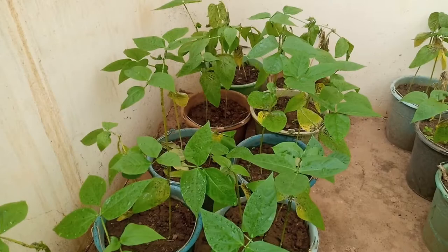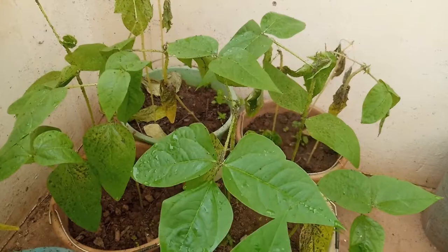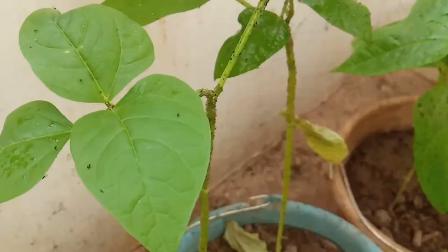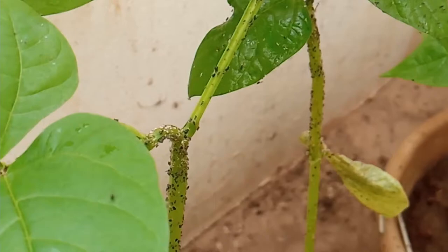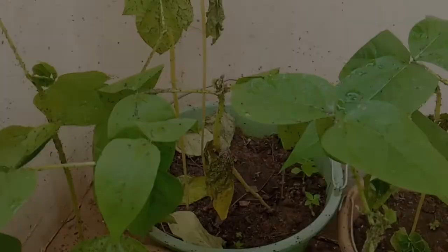After 21 days, plants are scored on a scale of 1 to 5, where 1 is resistant and 5 is susceptible.